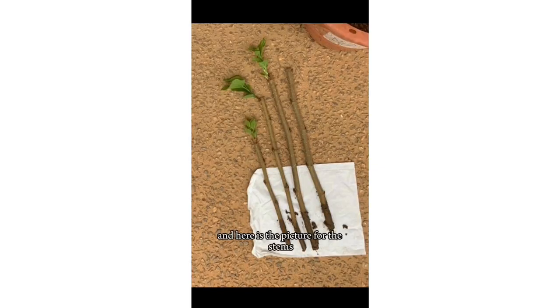And here is the picture for the stems that were not applied with auxin. We can clearly see the difference, which is that there are fewer leaves or no leaves at all, and there are no roots at all or only one strand of root.